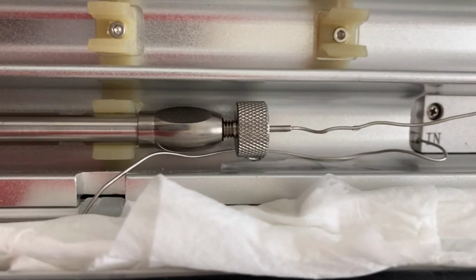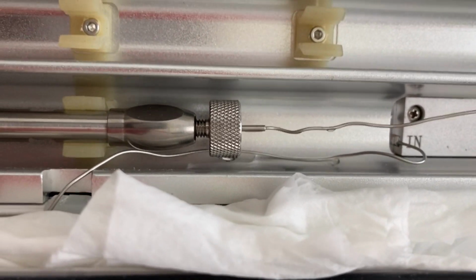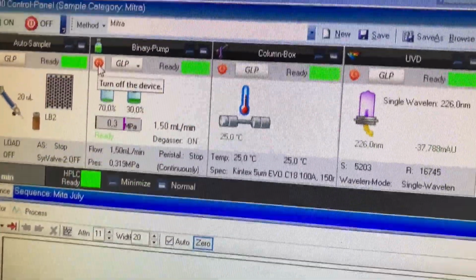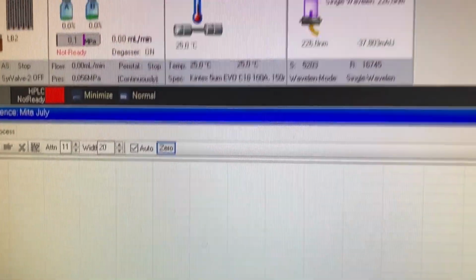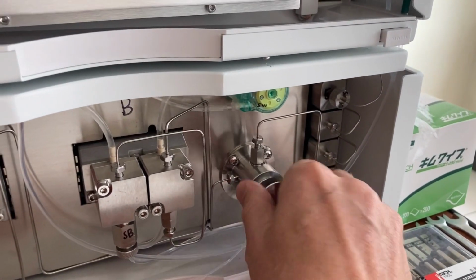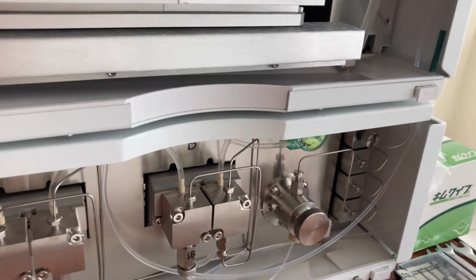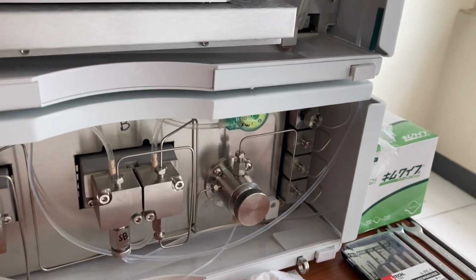When the pressure comes up, it's leaking, it's blowing it out. That's a serious problem. Then I've got to come over here, turn the pump off, and take a look at this and I'll release that there as well. Start again. This is the fun and games with not being able to source the correct ferrule.